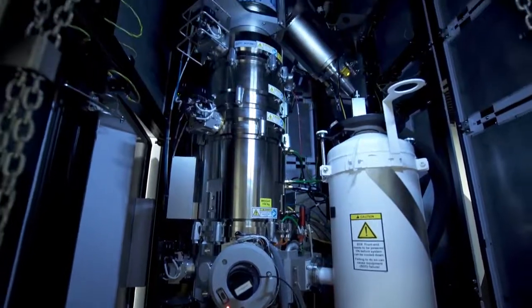At the top of the microscope column is the electron source, where the beam of electrons emits from. The electrons shoot out of the emitter and are accelerated to 70% of the speed of light, then focused into a small point by a series of electromagnetic lenses.